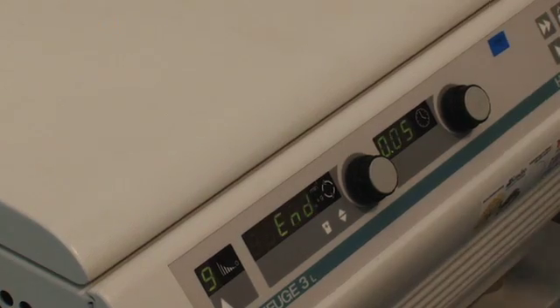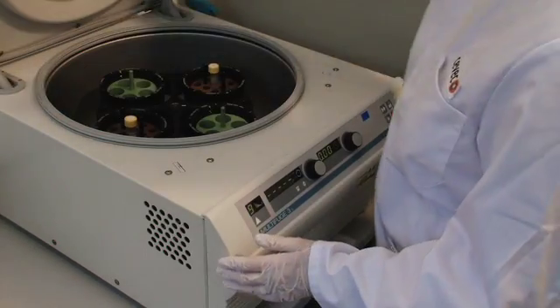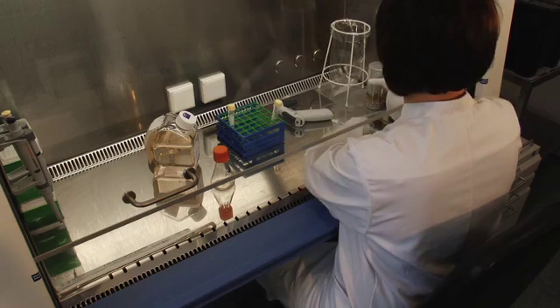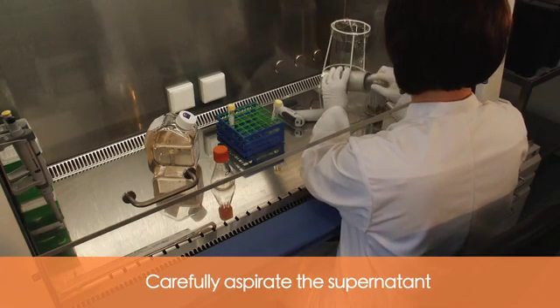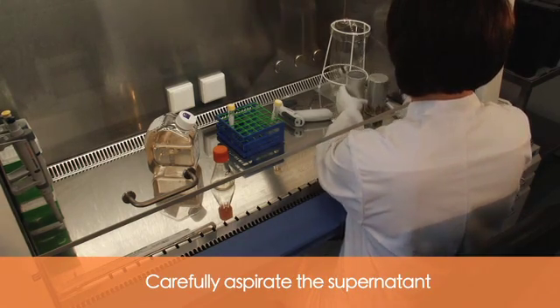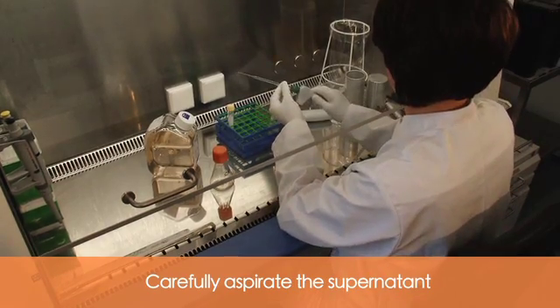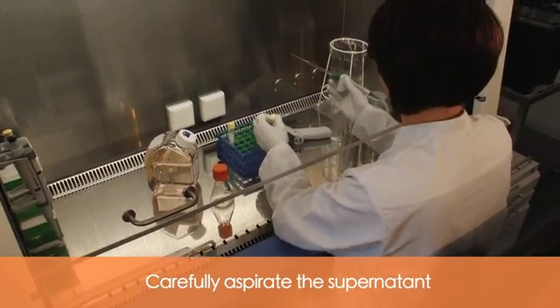Do not spin faster. Aspirate the supernatant completely, since small amounts of PEI can negatively influence transfection.